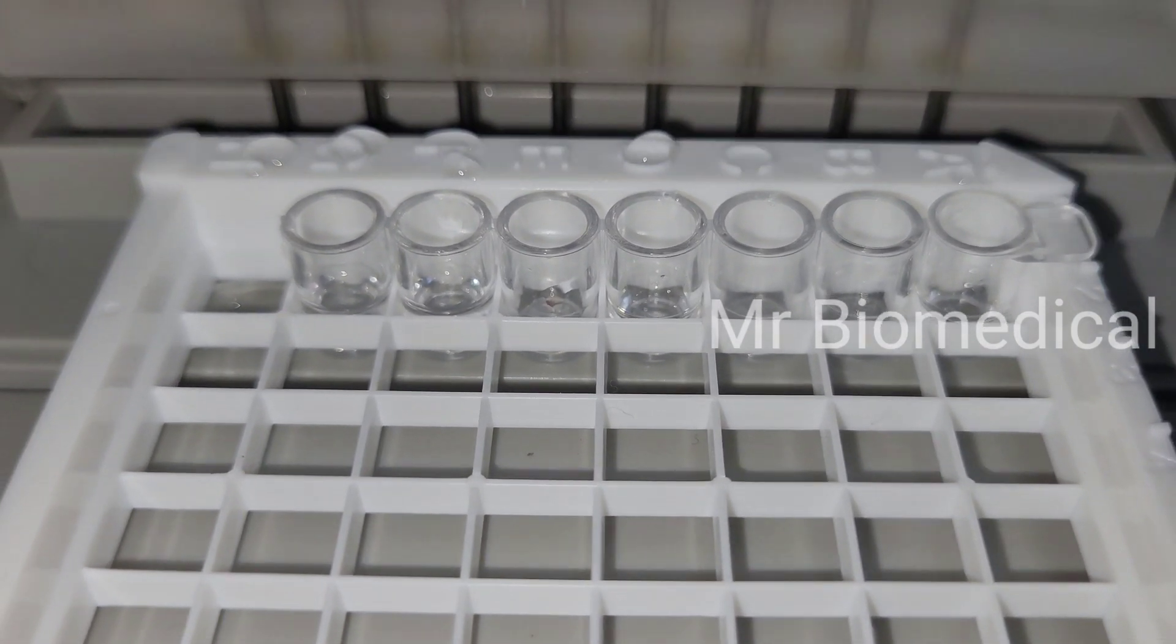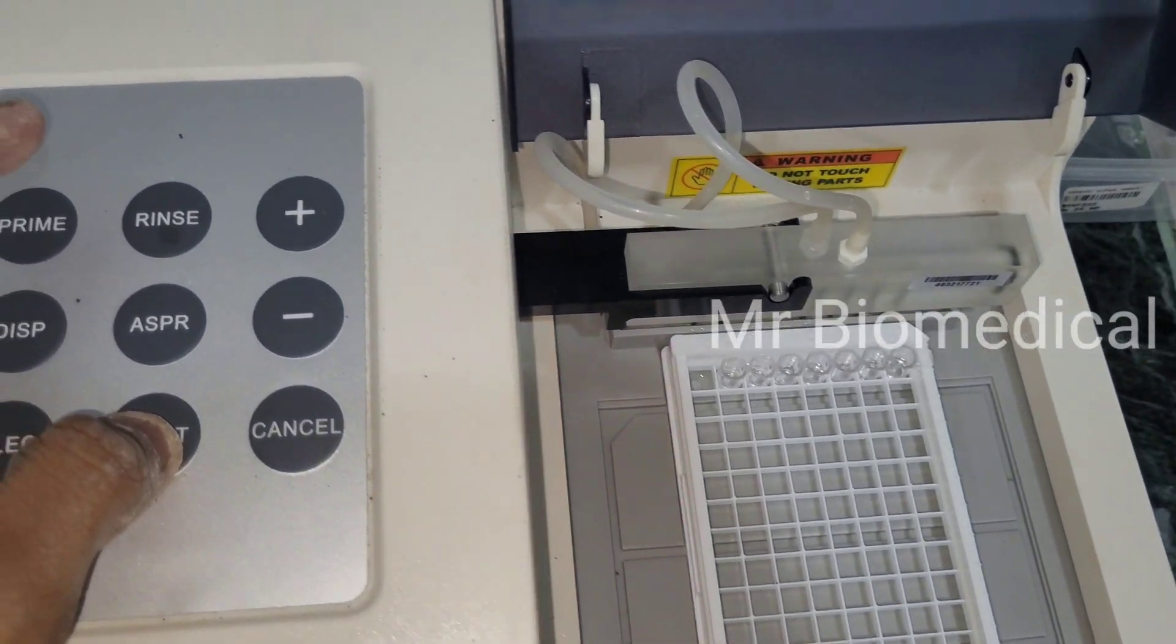That can be easily removed. So once we remove the block it will work properly.